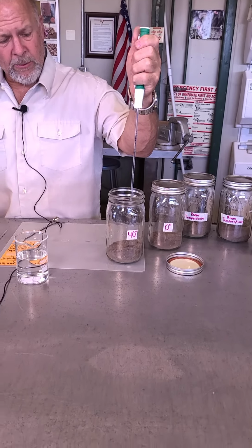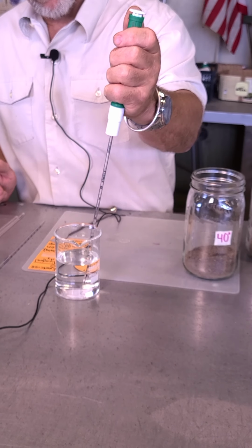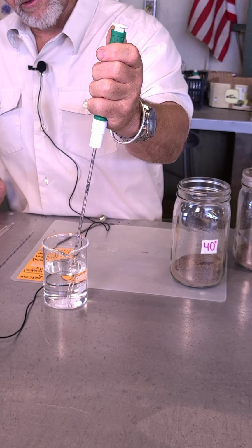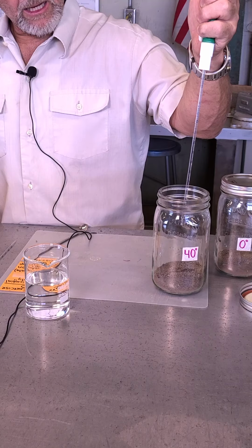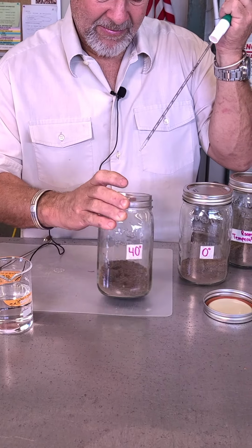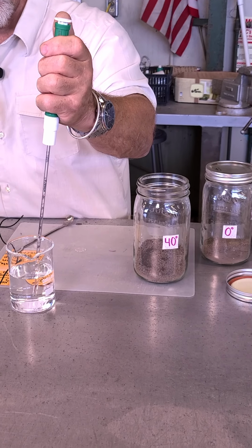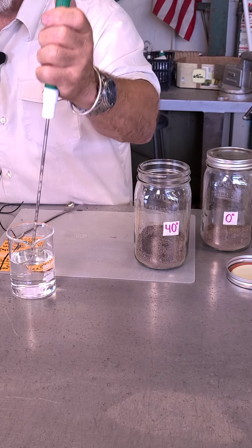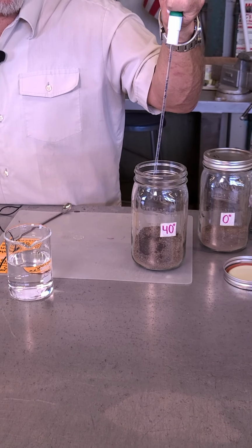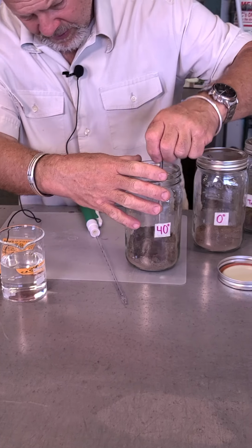What I want to do is make sure that's enough, and it's not going to be, so I'm going to go ahead and add a little bit more. Let's see if 20. These soils are really dry. So that's 20, and I'll mix these up a little bit. I might even need a little bit more, I might even need more than that. So I'll see what 30 looks like in this. I've got more soil if I don't like what I've done. But I will mix that up and see what that actually looks like.